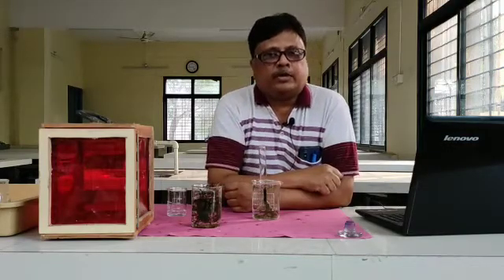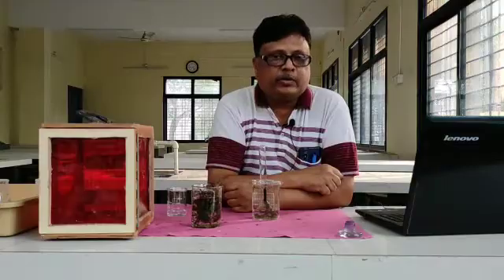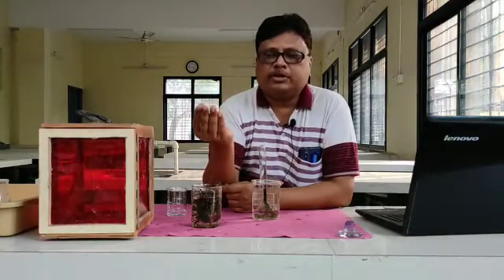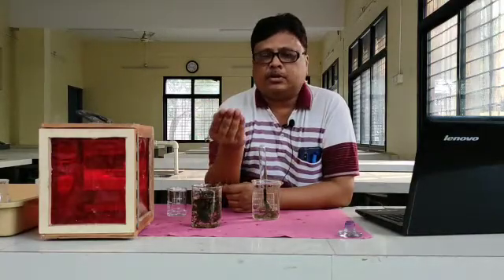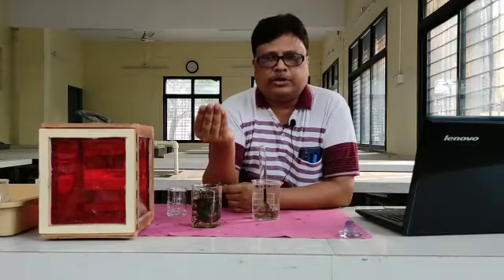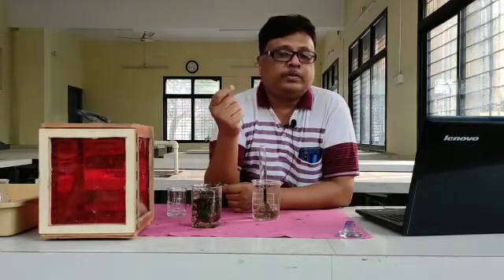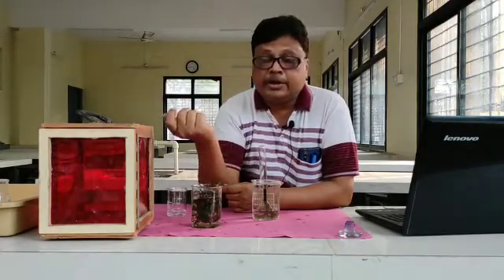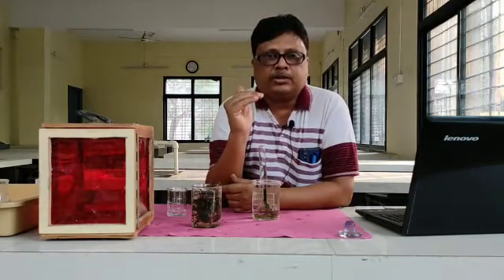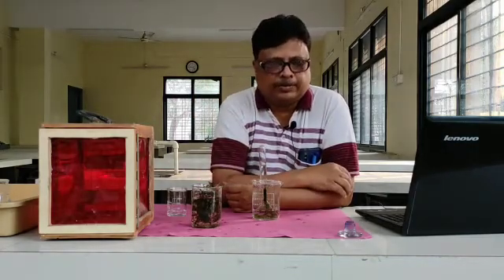This is the photosynthetic experiment. Questions may be asked like: what is photosynthesis? What is the effect of sodium bicarbonate on the rate of photosynthesis, or the effect of light intensity on photosynthesis? Such questions will be asked in your practical examinations. Thank you.